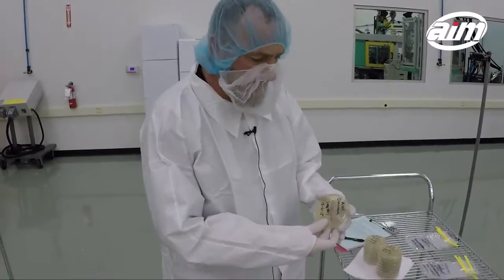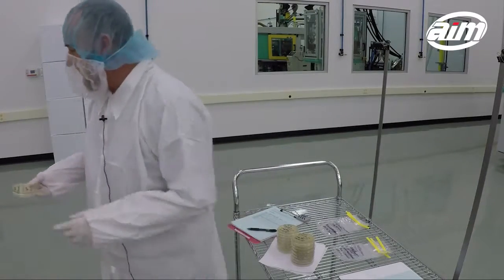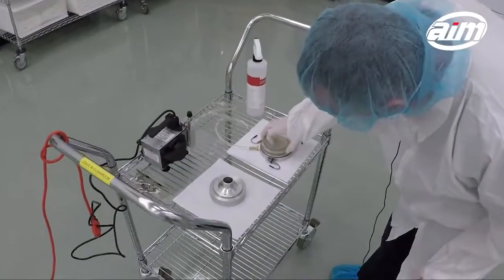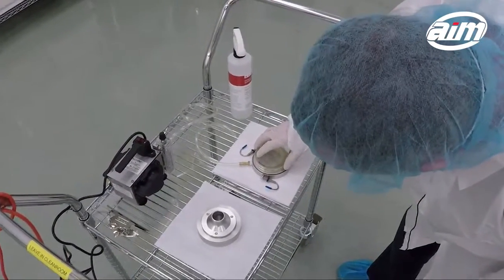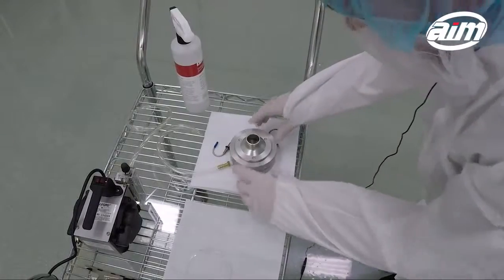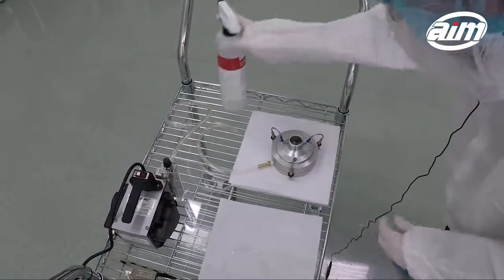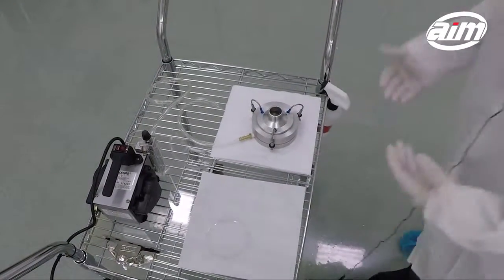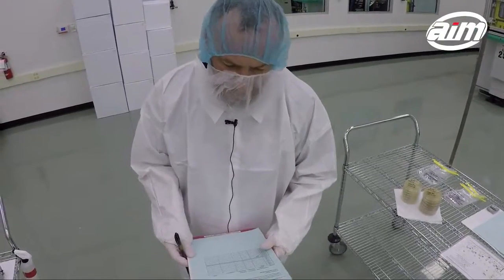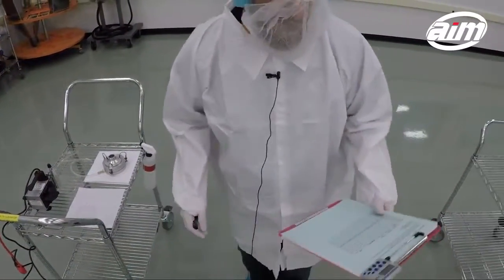I'll take a sample plate with a sample medium on it — this is for the bacterial counts. I place the plate down onto the impactor base and remove the lid covering the sample medium. Now the agar plate is in the housing with the hold downs on it. It freely draws air into the plate. I set a calibrated timer, and once I start the pump, I start the timer and we begin our 10-minute sample collection time.